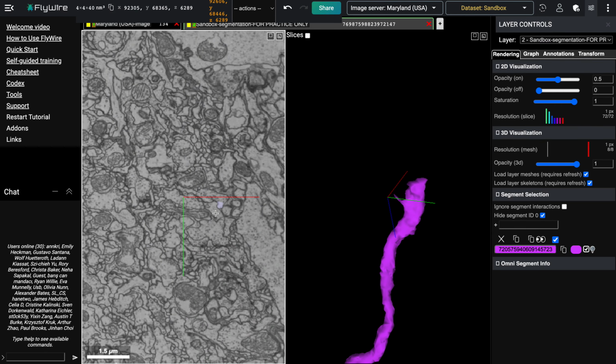So it looks like there's just some other stuff in this area that's replaced our cell, and that is what is happening. The issue is that this slide is misaligned from the previous slide, meaning that all of the images have shifted over, and it can be hard to continue visually finding the continuation that we're looking for.